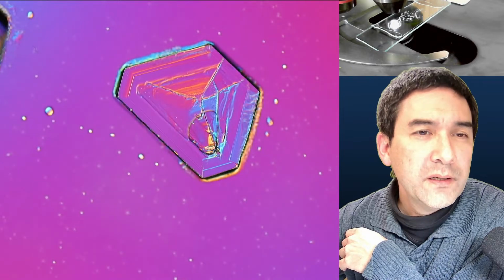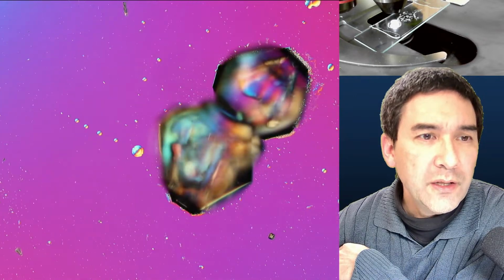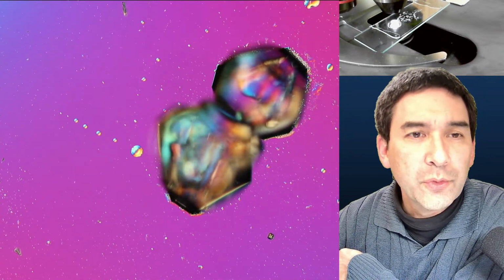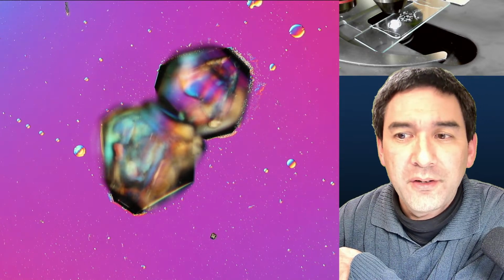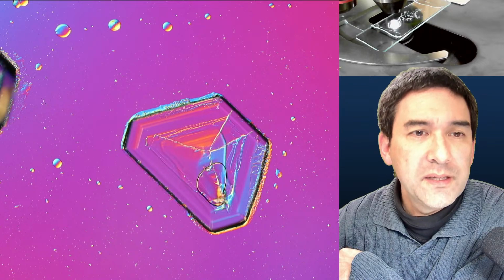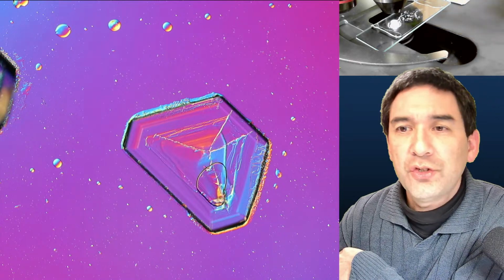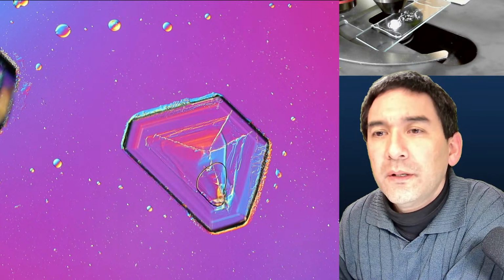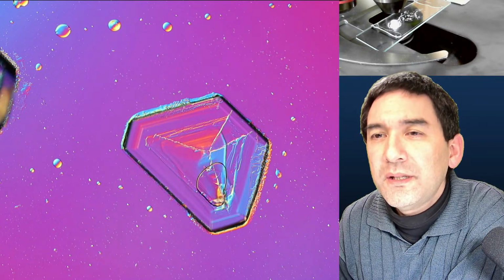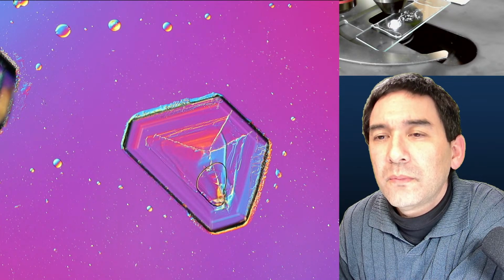Okay. If you see something like this forming, then these are actually crystals that started to form out of the solution. And those are still those crystals from the original substance, which have not completely dissolved yet, and sometimes there was also recrystallization happening there. Okay, but that is basically one of those crystals that formed by recrystallization. So I'm going to have another look here. So let me see. Let me see again here.